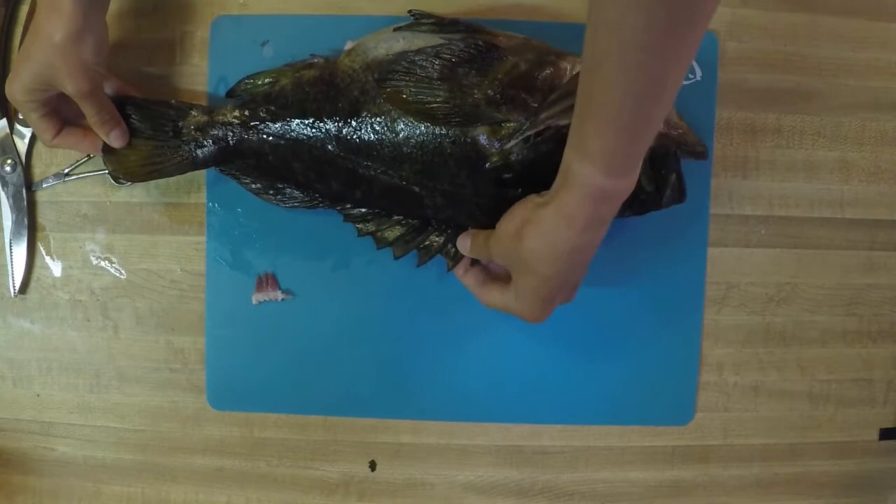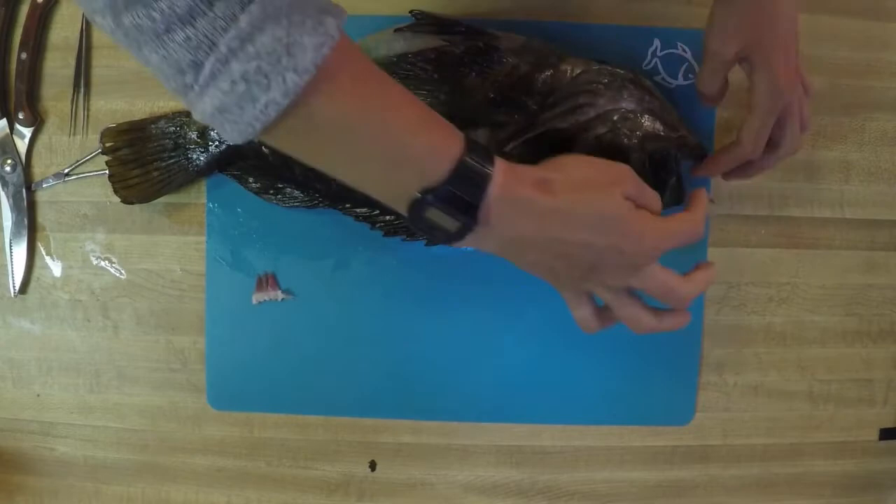So check out the eyes on your fish. If you want, you can cut that eye out, open it up, and explore the inside — see what kind of parts you can find within that eye. Fish have lenses in their eye just like we do, but our lenses within human eyes are kind of lentil or football shaped, where the lenses inside of fish eyes are more of a perfect round sphere. And so that helps them focus the image underwater. Seeing underwater versus on land is pretty different, so the biology and anatomy of the eye is going to be a little bit different from a human eye. So far we have covered our fins, scales, lateral line, operculum, gills, eye, mouth, and teeth.